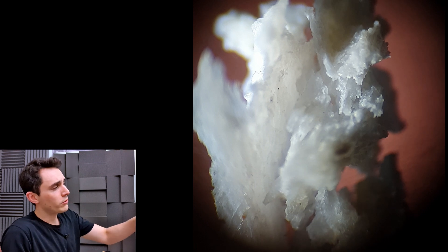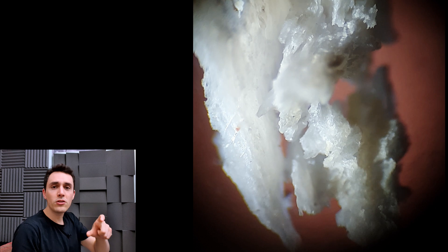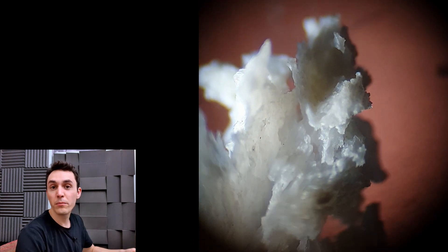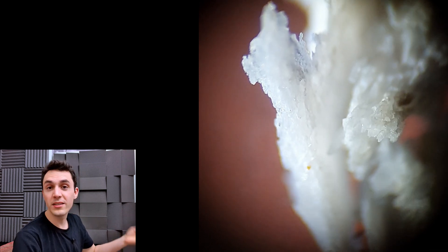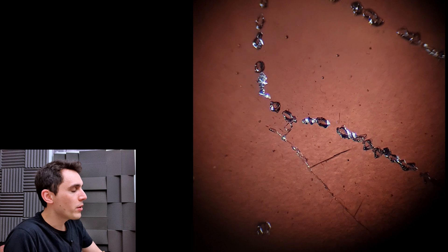But this is what it looks like after two days immersed in this little test tube of potassium hydroxide. So if it was just a little clump of dead skin, it would have dissolved into nothing — probably within five hours it would have just been mush. But here we can see it's a nice white piece of bone.